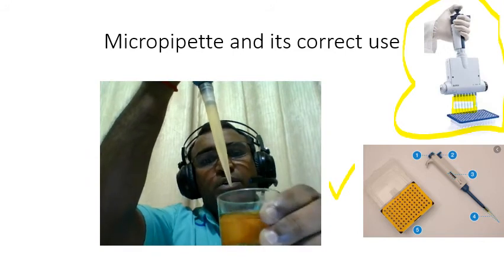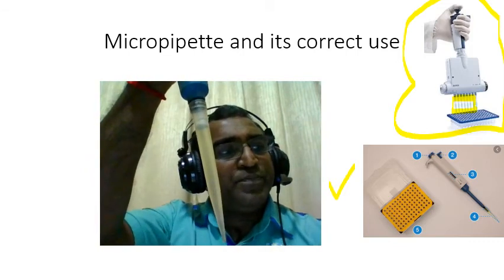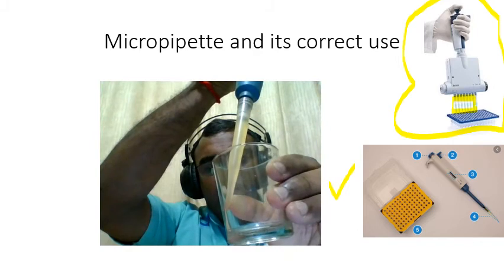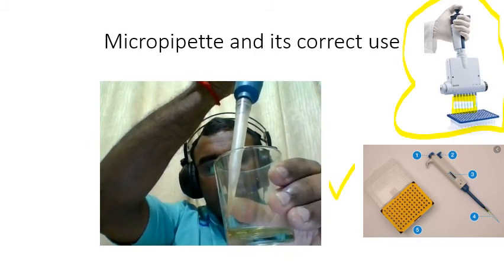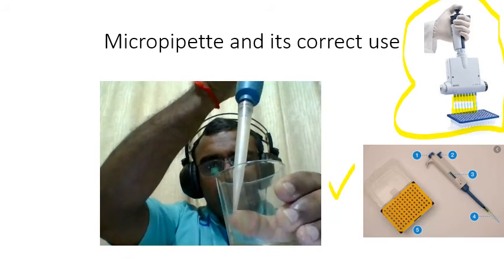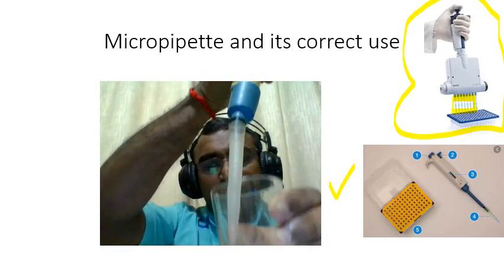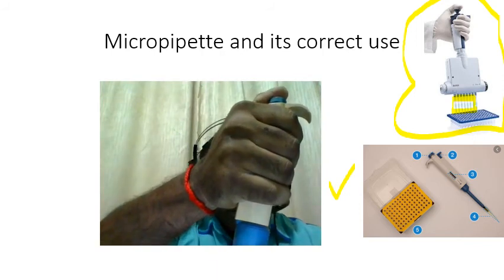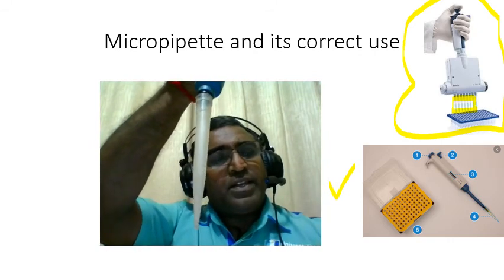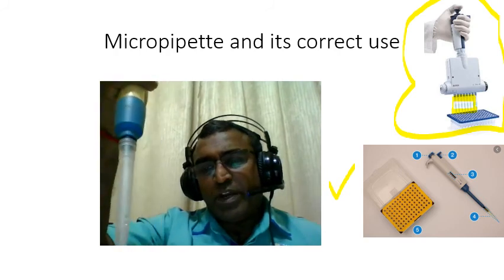Next thing, you can draw out the filled tip with the 4.5 ml. Bring it to the container that you want to transfer to. You can touch the edge if you want. Press all the way until that first resistance, and don't stop there because you can see there is a little bit left. In order to release the little bit of volume of solution, press one more time beyond the first resistance, and you will see it comes out. So that's the effect of using the micropipette correctly.